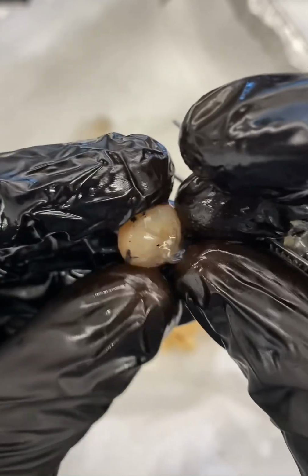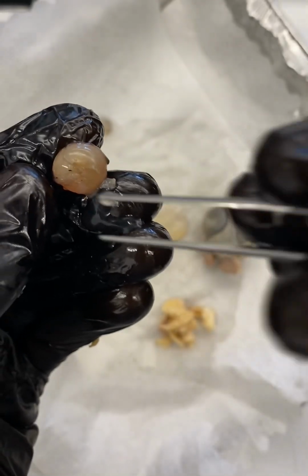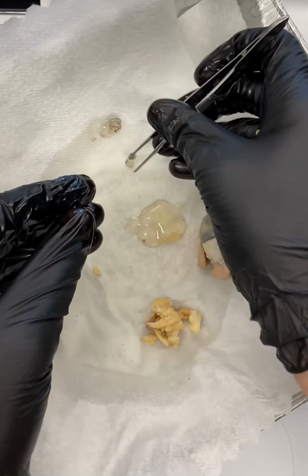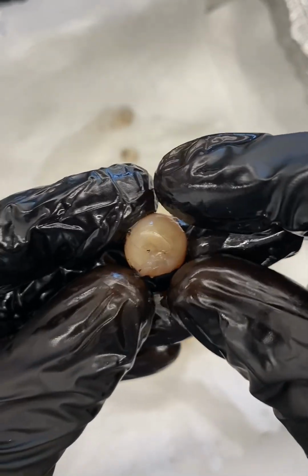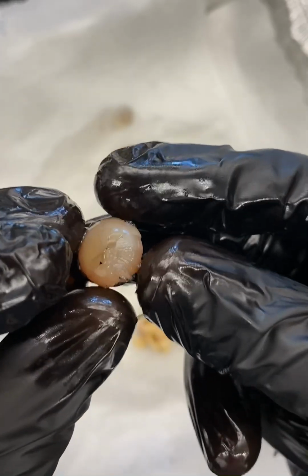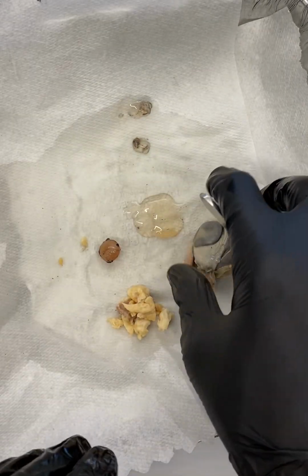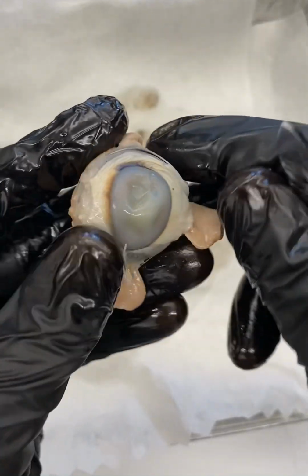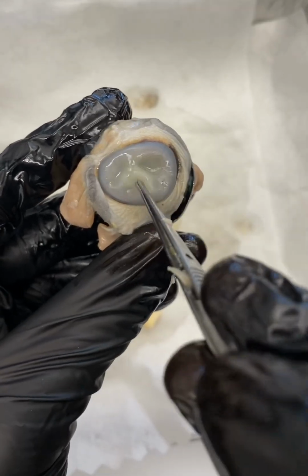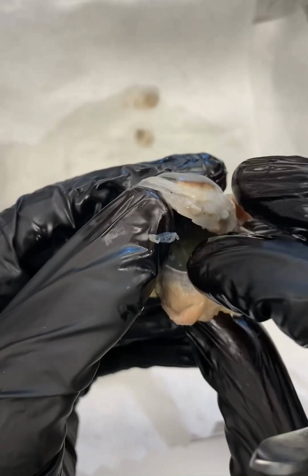Ordinarily, in a living human, you have this lens, and it is able to be stretched, and it easily changes shape. What this lens is doing is, as light is passing through, we'll set the lens down for a second. As light is passing through our eye, recall this would be our pupil. There would be a hole here, and you can actually see the pupil a little bit easier if we come to this inside view, this internal view.